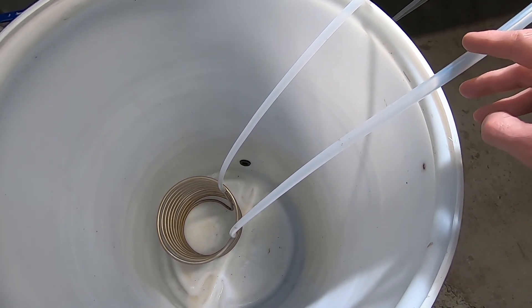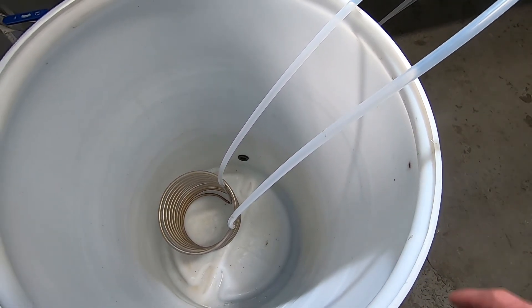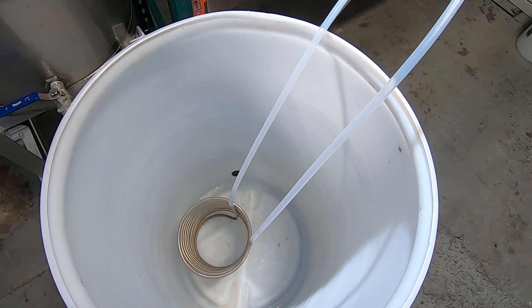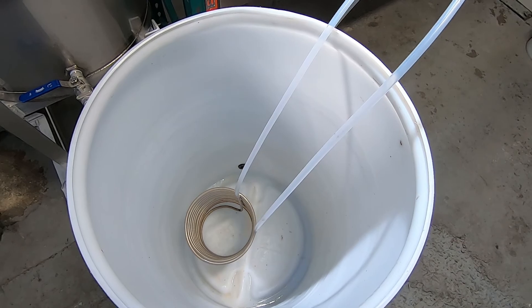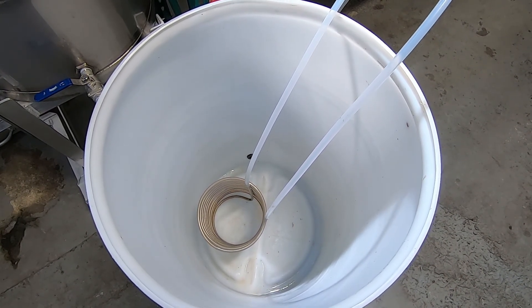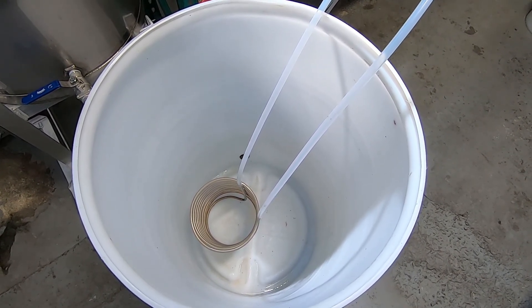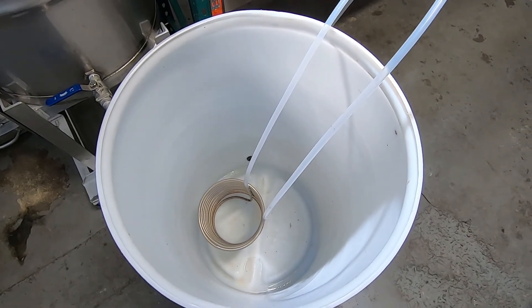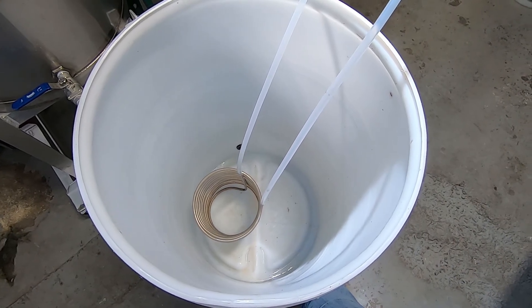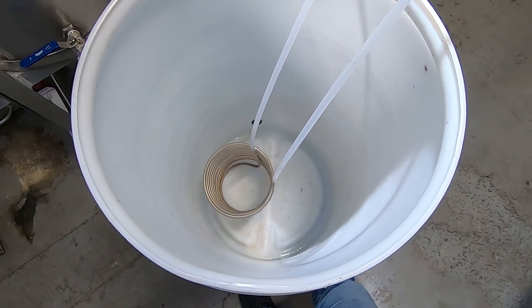The other thing that's important is the material you're using to do this. I'm using PTFE. When you're combining pure alcohol with high temperatures, if you're using PVC or any other types of standard brew lines or mixed blends, you can have leachables that'll get into your alcohol, which is not good — a lot of them can be poisonous. They'll travel into your oil and you won't be able to get rid of them easily. So make sure you're using compatible materials. The other thing is keeping any metals you have to stainless steel.